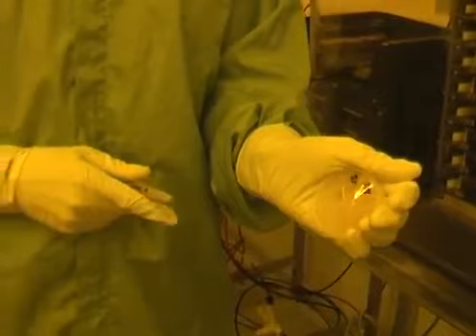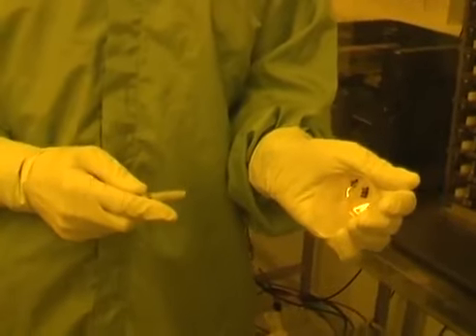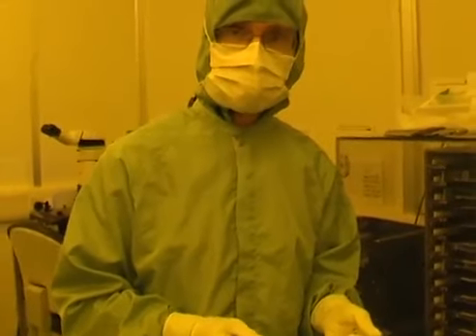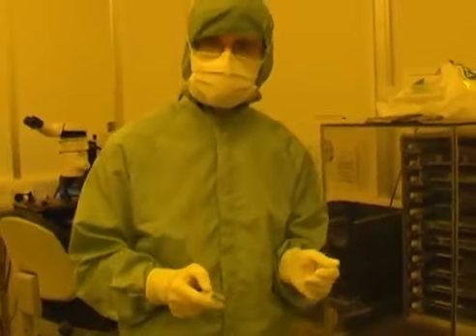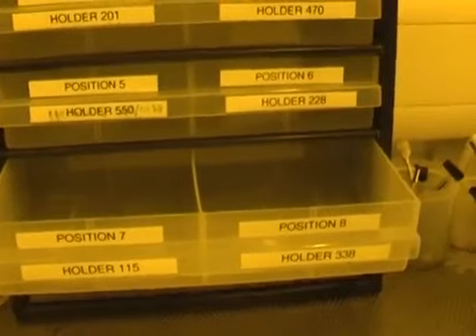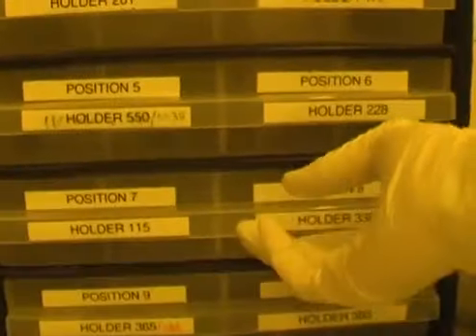So when you see writing at the back of your sample, this is what the operator's been doing so that they can know where to unload it the next time. This is especially important if it's a different person the next day who's unloading the sample, which sometimes happens. So we need a system which works. So if we look here, holder 388, position 8, and I simply place that in there, and that's ready for tomorrow.